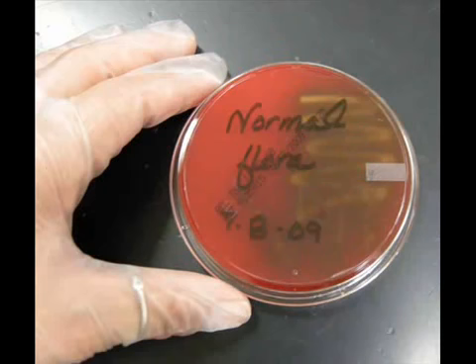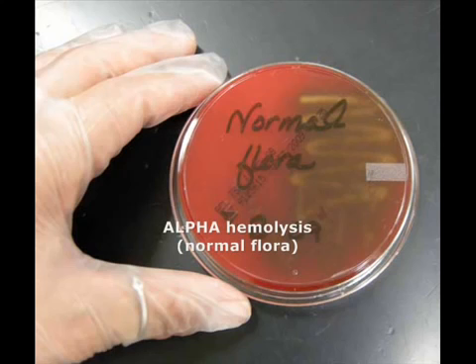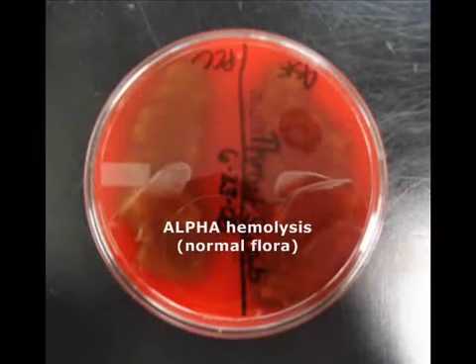Now here's a different blood agar plate that has bacterial growth, and when I look at the bottom of this plate, the medium looks bruised. It has a brownish appearance to it.